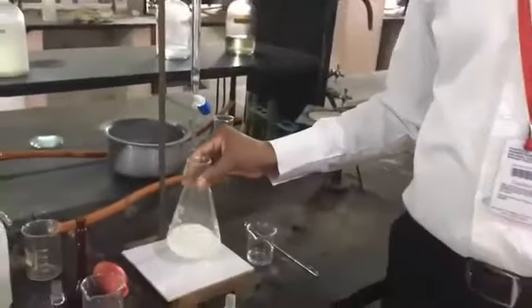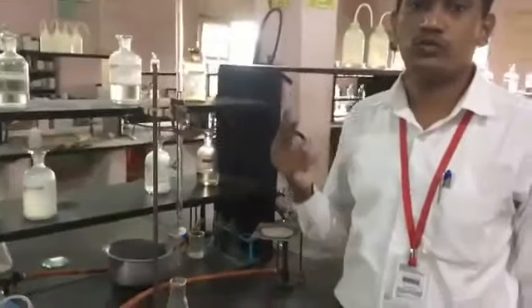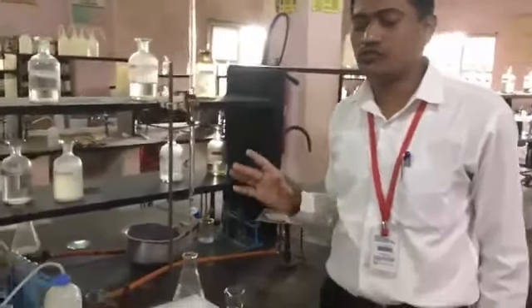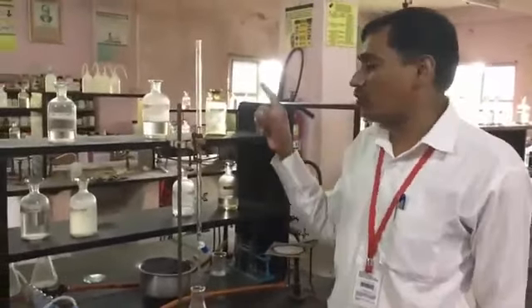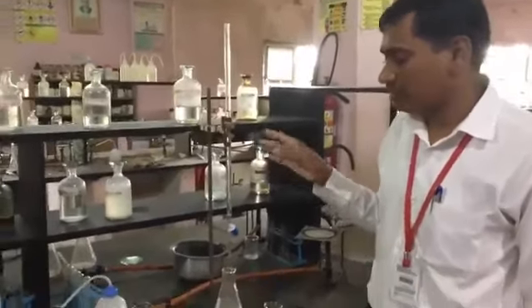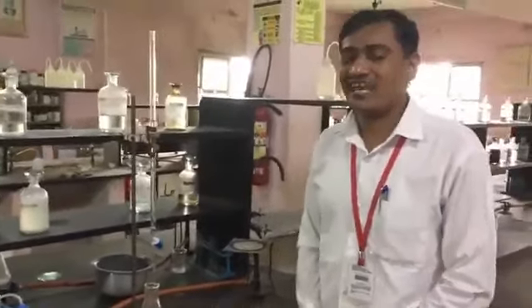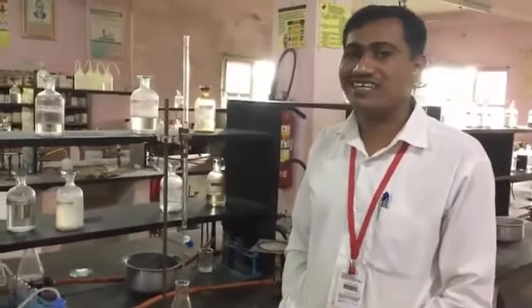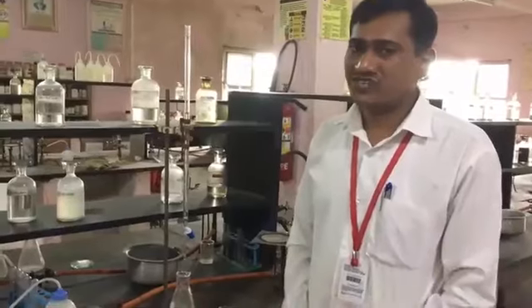So these three readings we have taken, and out of which we got two constant readings, that is 9.7. So note down, your constant burette reading is 9.7. After getting that 9.7, the calculation part we will discuss with the help of a presentation.